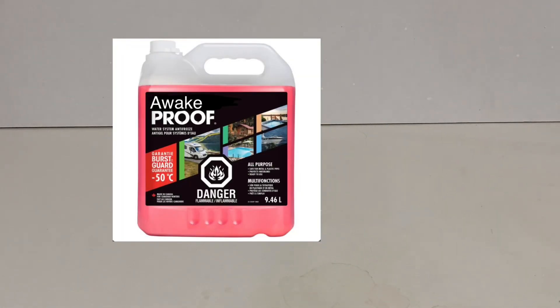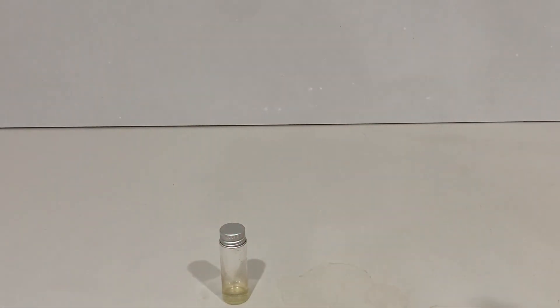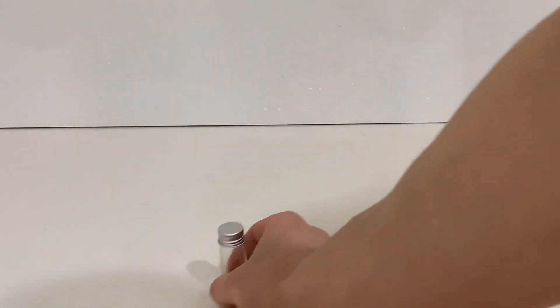In preparation of the toxic anti-awake, I'll be using the acetone I made last time. Here's a bottle I purified — there was a lot less of it. I distilled it again so now it's a lot more yellow, there's a lot more acetone in it than any kind of organic junk, and there's a lot less water in it.